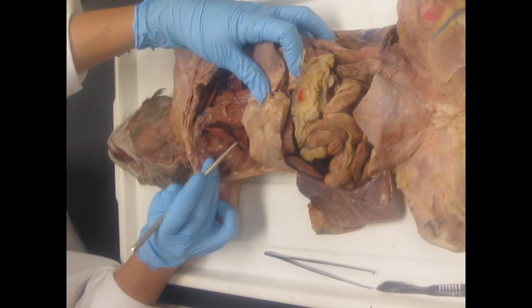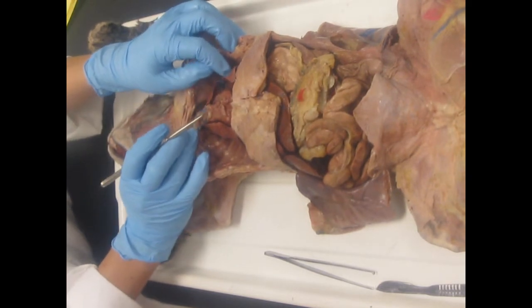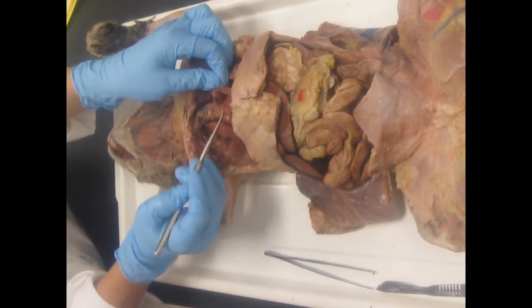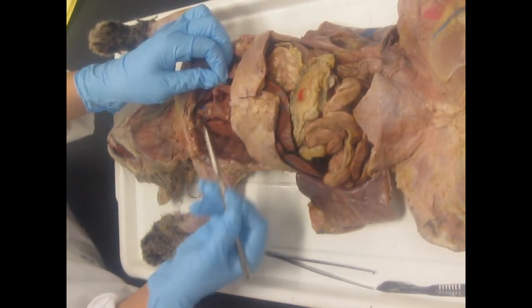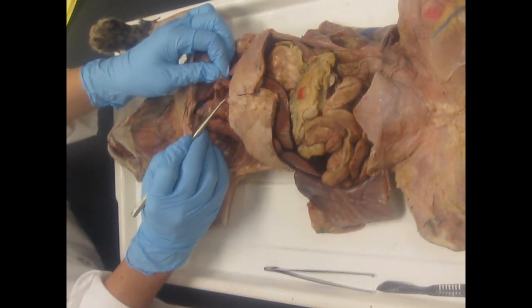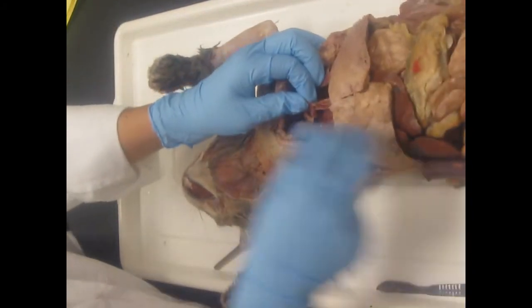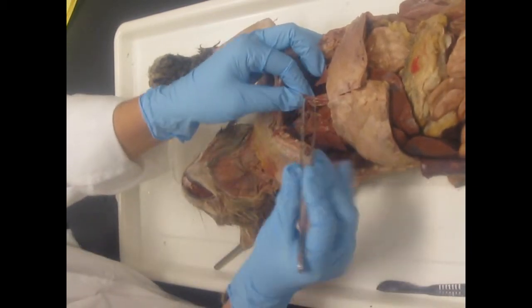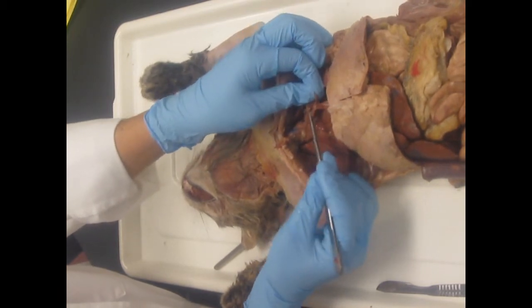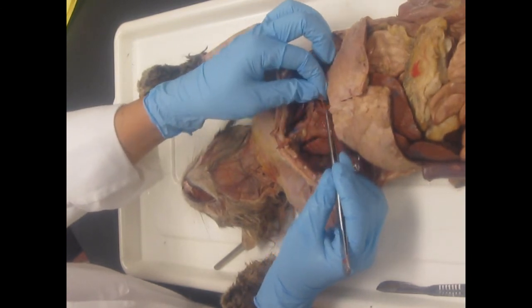So here's the lung on the other side. On the organ is the visceral pleura. Now we have the parietal pericardium and the visceral pericardium. So here's the heart. Okay, it's kind of got some of this goober stuff on there. On the heart will be visceral pericardium. Then, if you look closely and pay attention to what you're seeing in this cavity, you actually have two layers to what I'm holding. You have a really tough fibrous layer, and I can pull on it and it doesn't tear. And then this layer comes easily away.